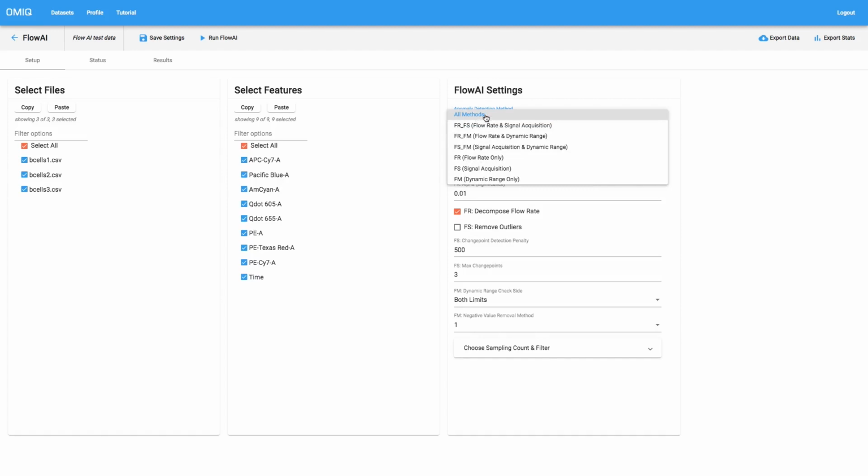It's common to choose all methods, but as you grow to have a better understanding of this algorithm, you can choose either an individual method or different combinations of two methods at a time. For this example, we'll choose all methods.